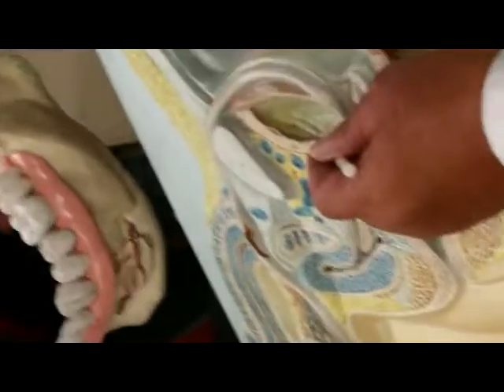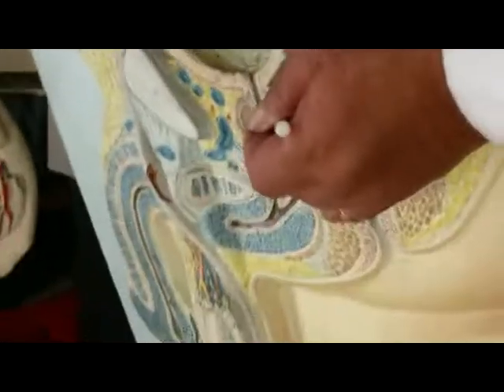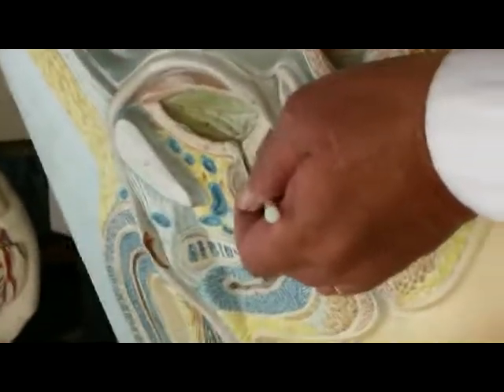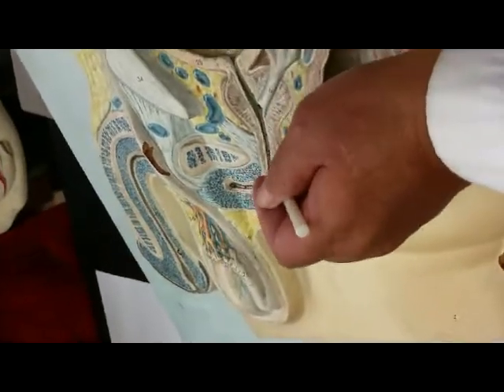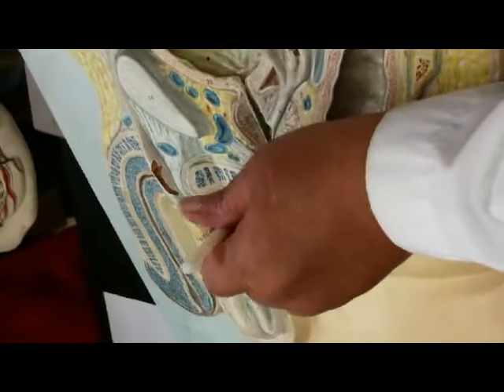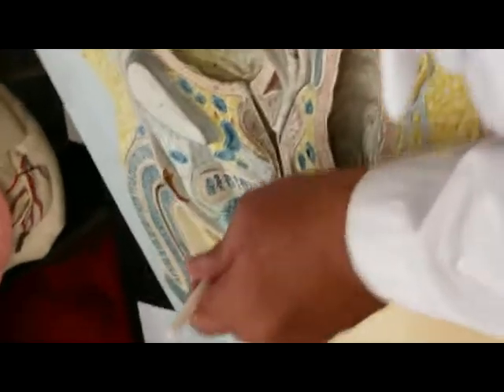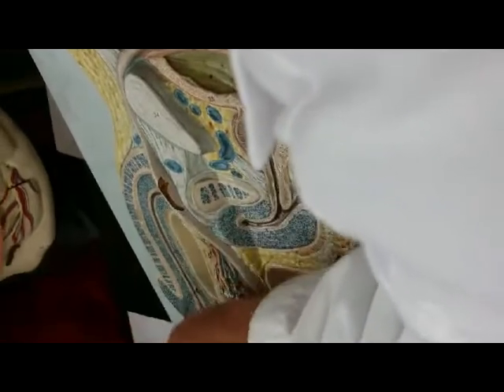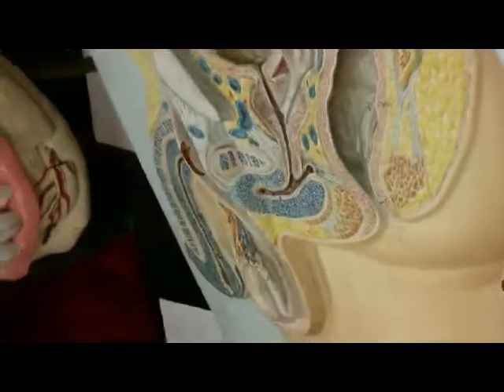So here is the urethra leaving the urinary bladder, passes through the prostate gland. It's carrying urine. It can also carry the semen with the sperm, and it passes right there. And this is called the urogenital diaphragm. So that would be the membranous urethra. And then all of this is the penis, and it runs through the penis, the longest part of the urethra, and that's called the spongy or the penile urethra. So the male has 3 parts. If you notice here on the sheet, it tells you 3 parts of the urethra.